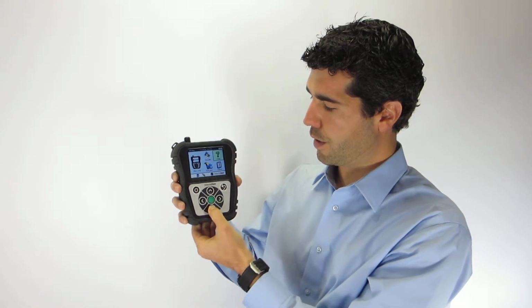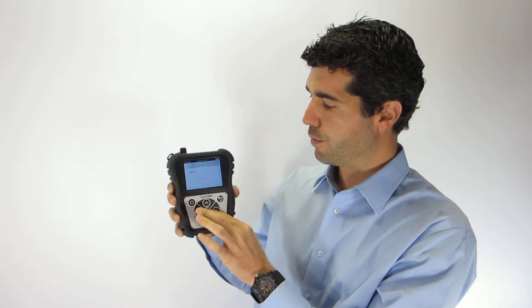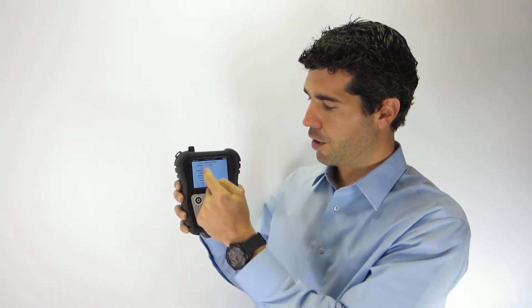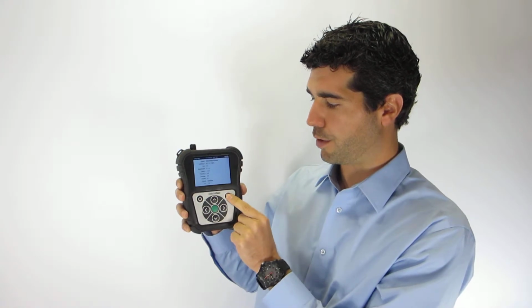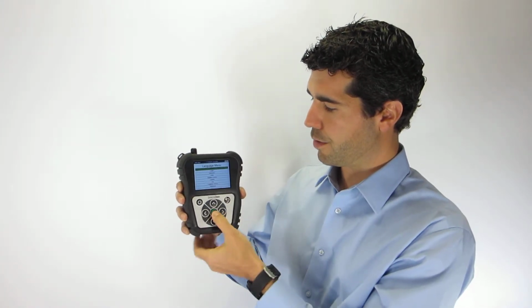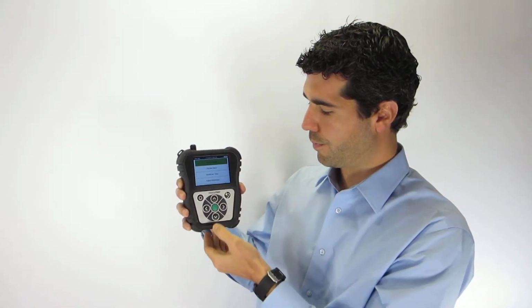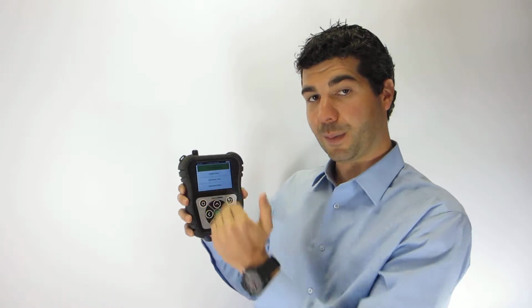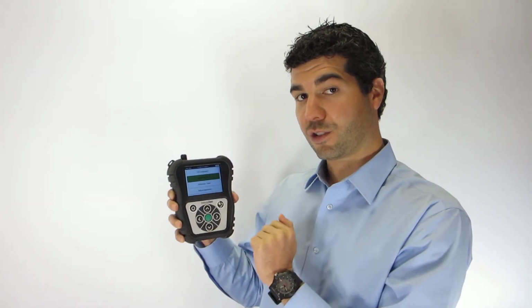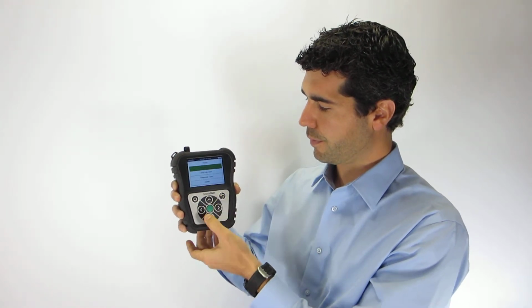Going back to the home screen, I'll scroll down to setup. Setup gives you the ability to view in status the Seeker serial number, the software version, and all the other information about the particular parts. Below that is the options. There's a way to set the language. Mine's currently in English, but you can see there's a wide variety of languages available. You can disable or enable the beeping function. You can set the shutdown timer that allows the Seeker to shut down and conserve power, and you can adjust the brightness of the screen.